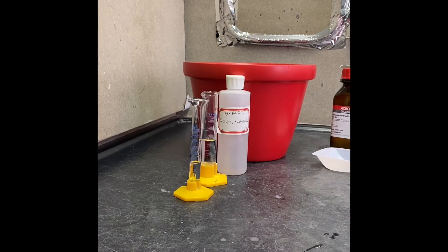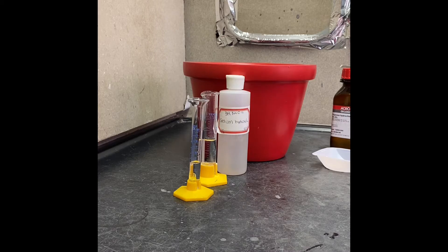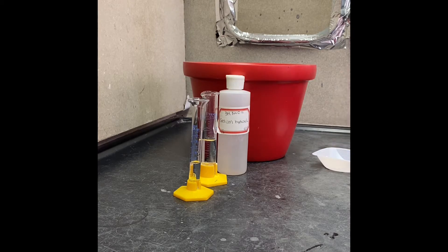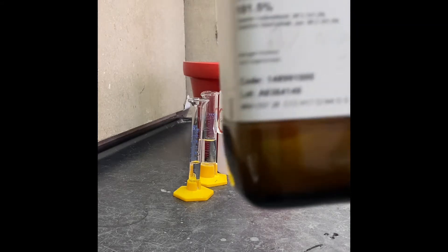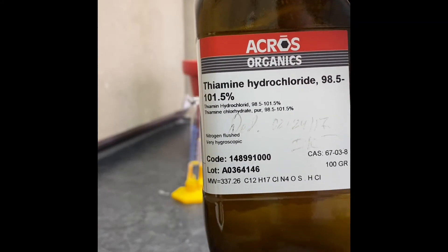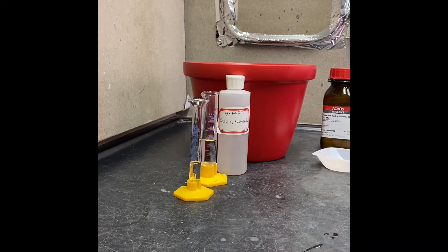We're going to do benzoin synthesis. As a catalyst, we will use thiamine hydrochloride, 1.3 grams of thiamine hydrochloride.